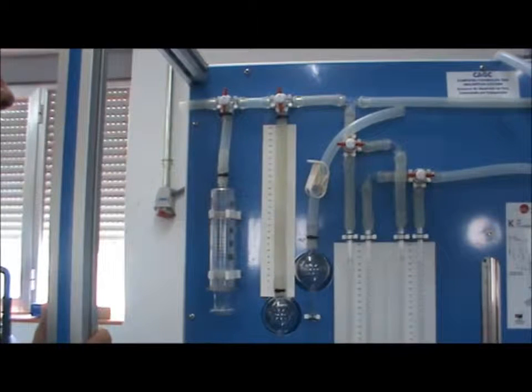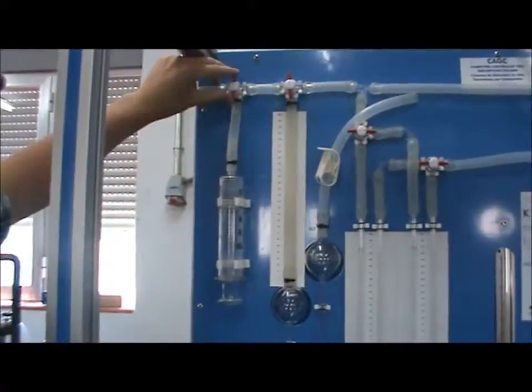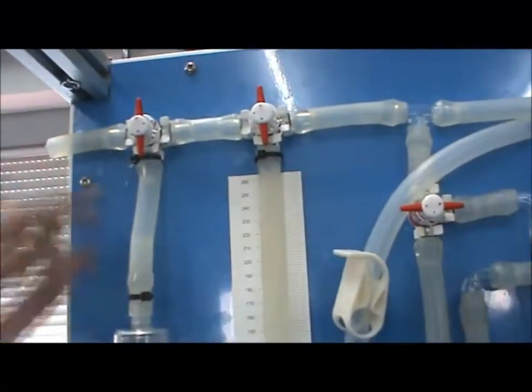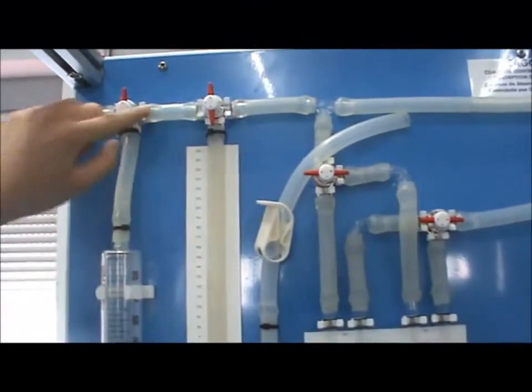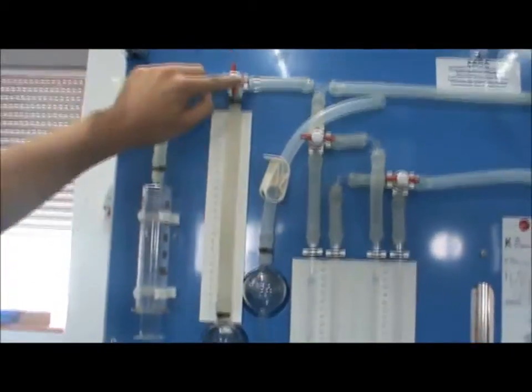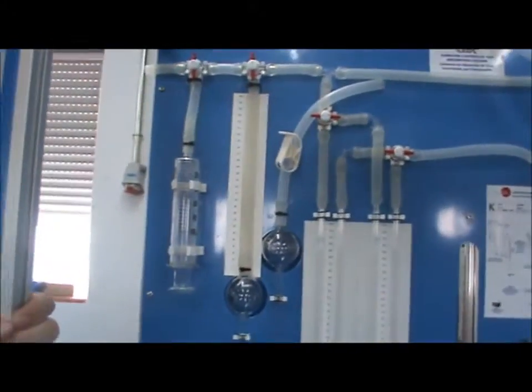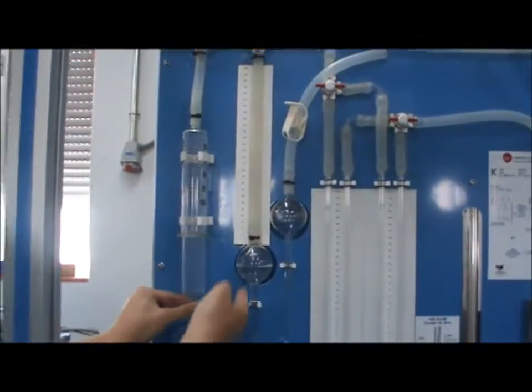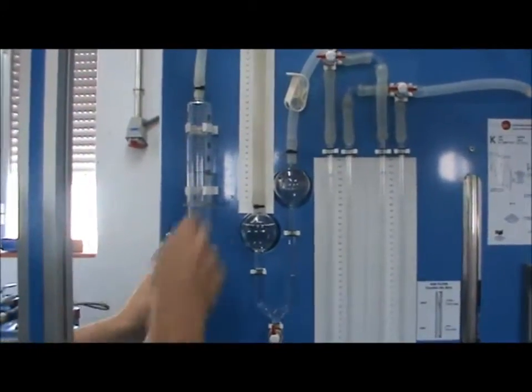Make sure the syringe is fully compressed by expelling the air to the atmosphere. Close valve VT3 to the atmosphere, which connects the syringe in this circuit, allowing it to charge the KOH solution to the vessels. Make sure valve V1 is open and push the plunger downwards, sucking the KOH solution up through the U-shaped vessels.